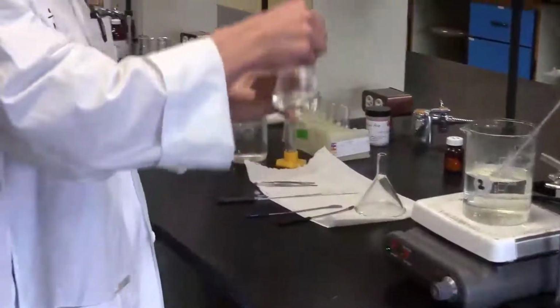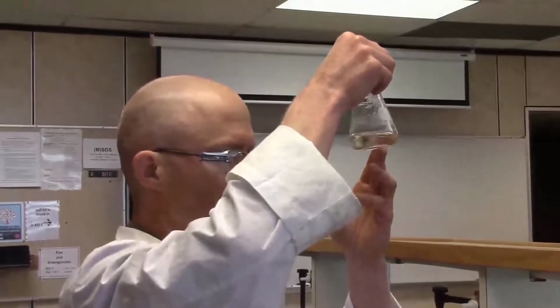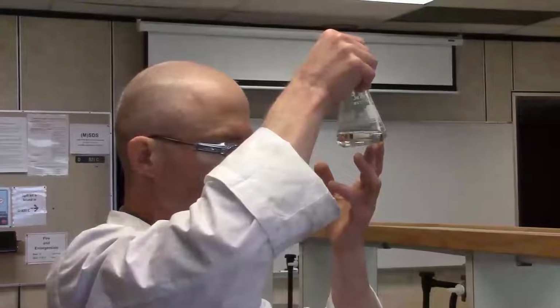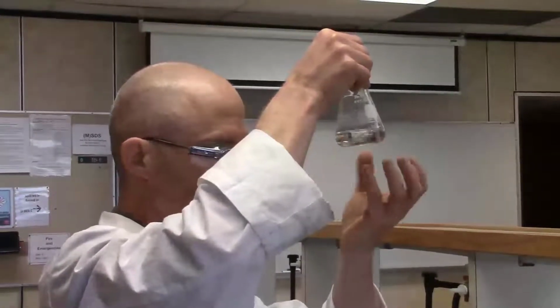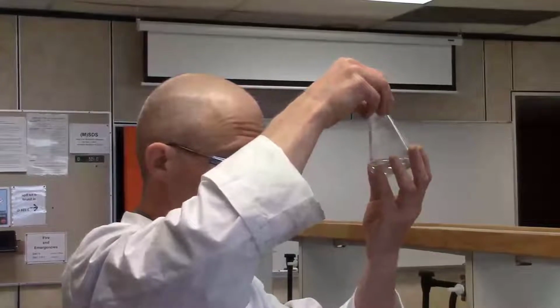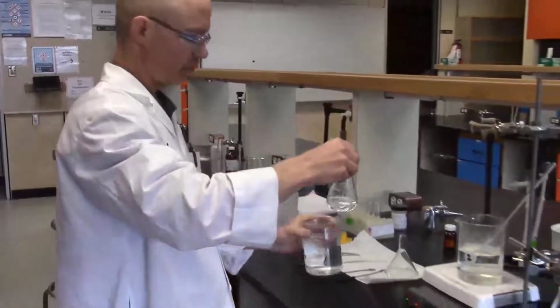So the cold water has now been added, and I'm going to do a little check before I put this into the ice water bath. This is definitely easy to be touched now with your bare hands in all parts of the Erlenmeyer. I'm just checking to see if any crystals have started to form. And indeed, I can start to see some small crystals, which I think is very satisfying because I know that I'm now going to be able to get the aspirin to crystallize out. So the next stage is to put this into the ice water bath.